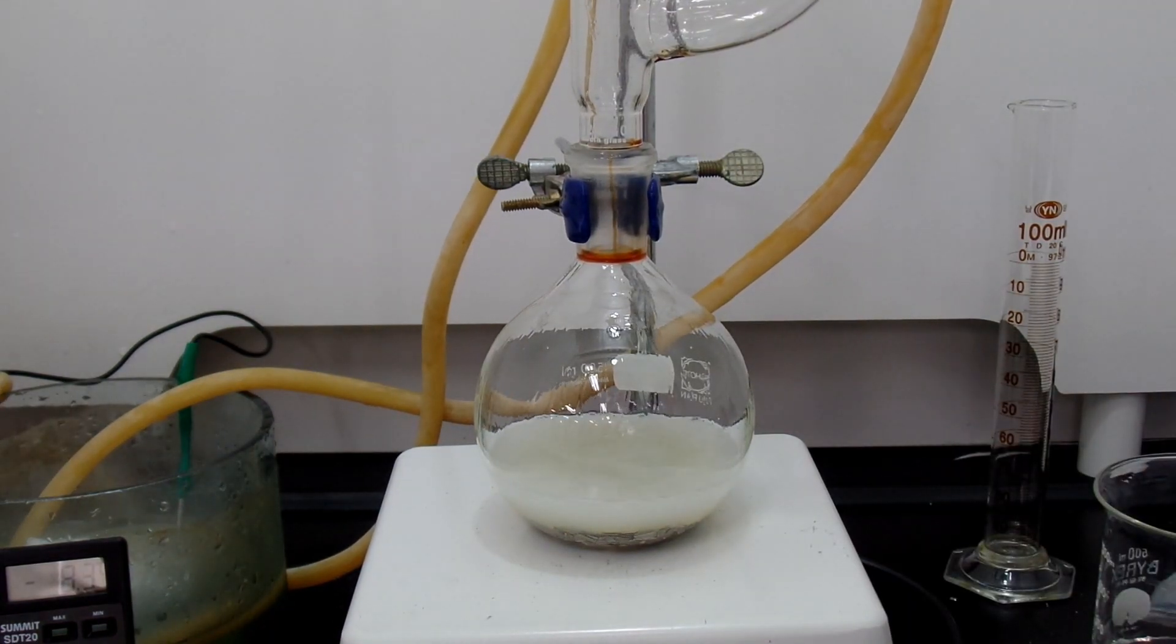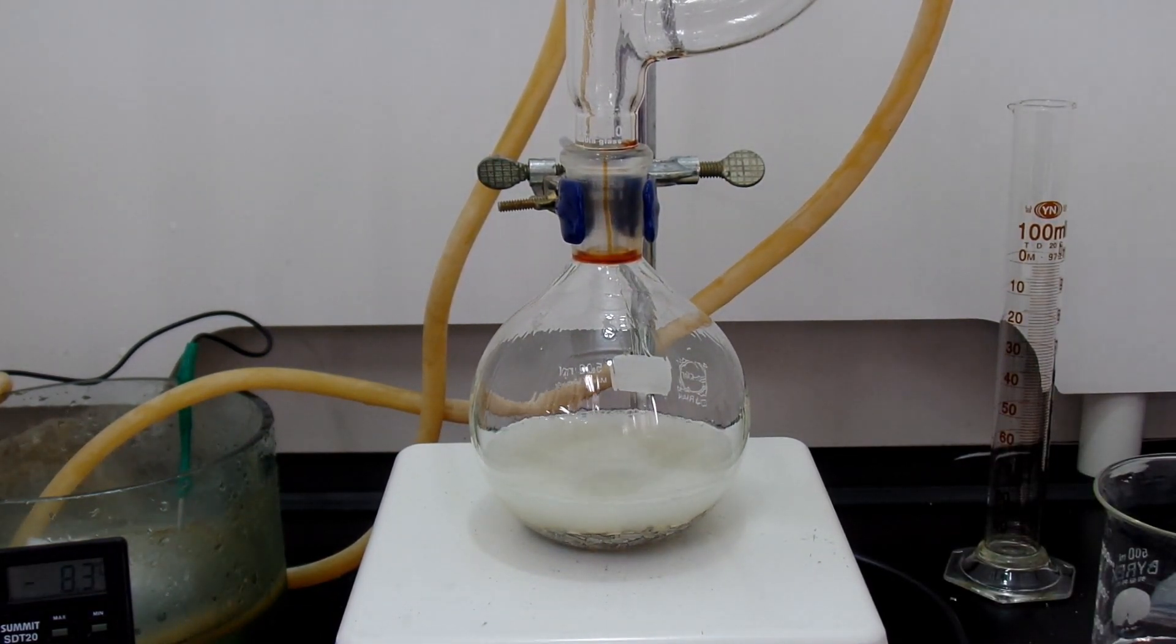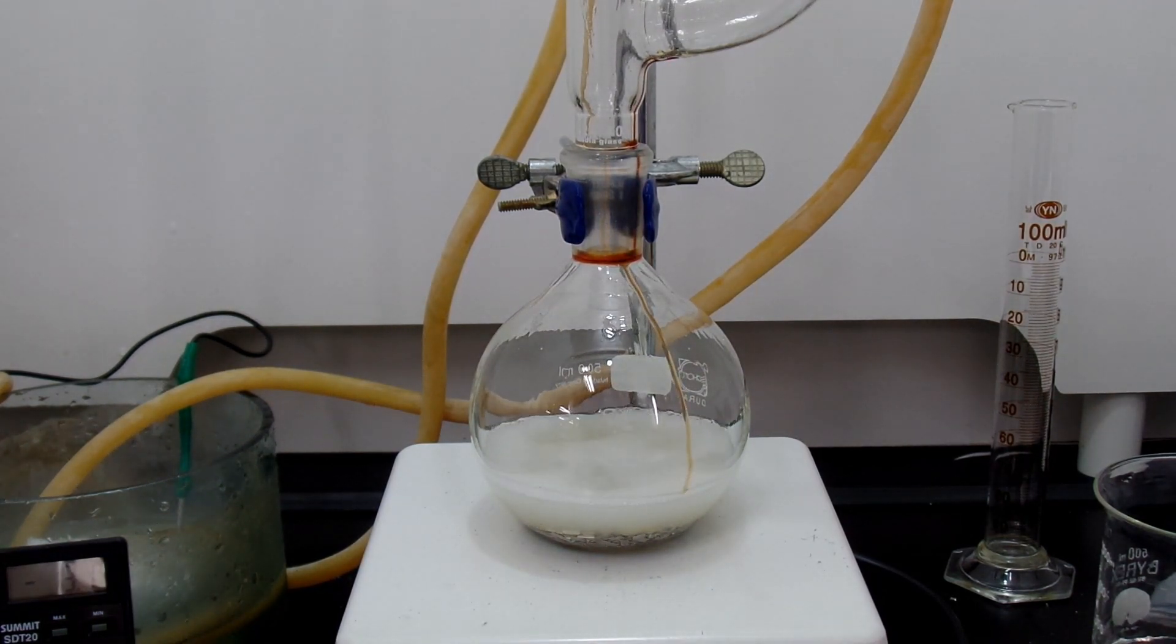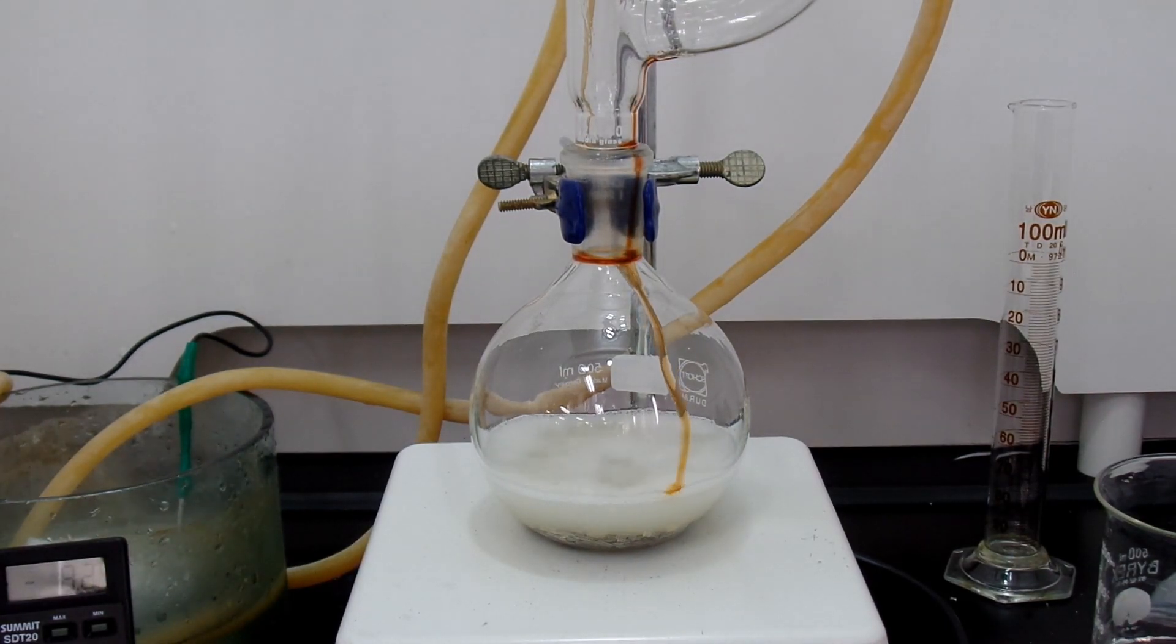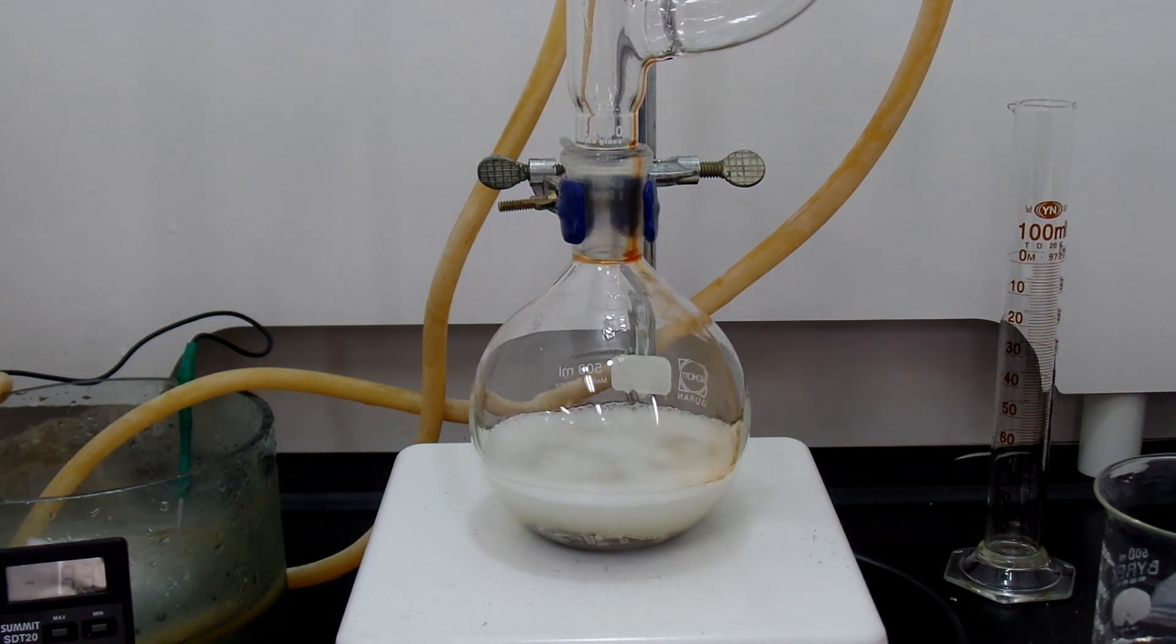So back to the experiment. With vigorous stirring, first you should add small amounts, about 5ml of 1-bromopropane and ether mixture. When you add too much, this happens. Adding too much at first will make your reaction go through thermal runaway, where there is positive loops of the reaction, ruining whole process.